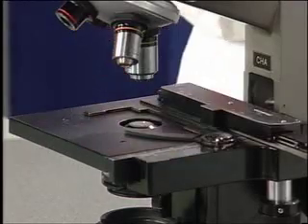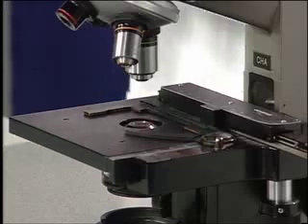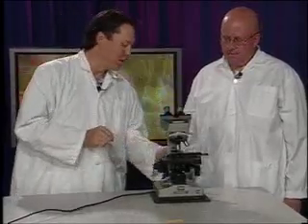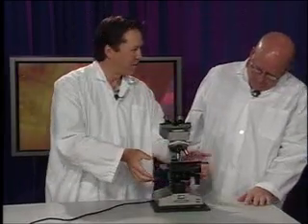Something that's very interesting about the microscope compared to other optics is that it's the actual specimen itself that moves in order to focus. If we think about cameras and telescopes, usually it's lenses that move that allow us to focus. With the microscope, we move the specimen. And in order to move the specimen, we're going to use these two controls here. A focus thing. The focus thing. And there's a big one and a little one. They're found on both the left and right-hand side.